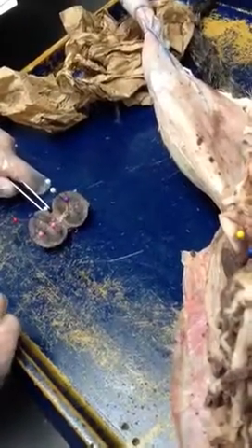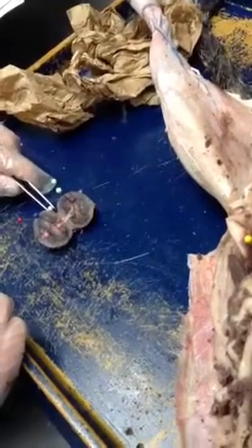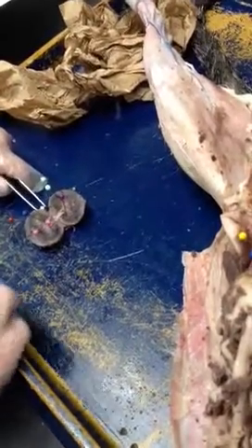The kidney. The renal hilum. Okay, hilum. What this actually is, it's an opening. It's the space right here where the ureter, the artery and the vein go in and out of the kidney. So it's just an opening. We'll maybe have a card that says opening if we want you to do renal hilum. That's the renal hilum. Yep.